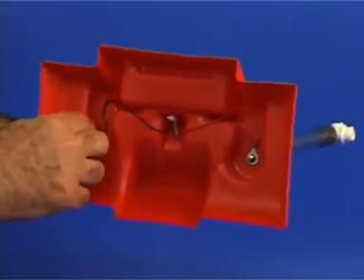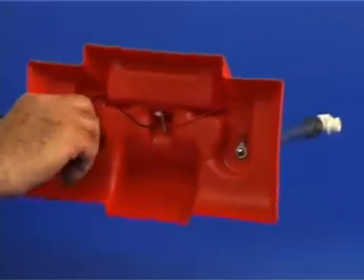Next, cut open one of the bags and pour the solution into the empty plastic container.